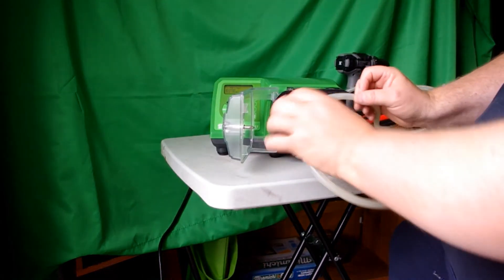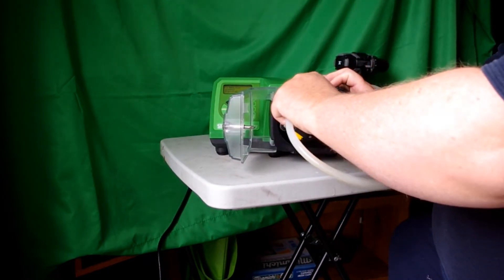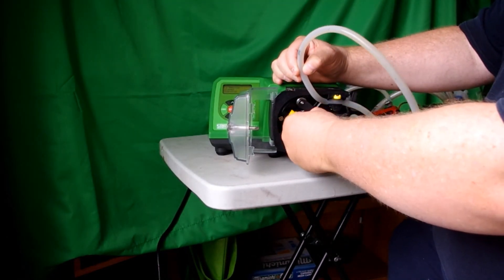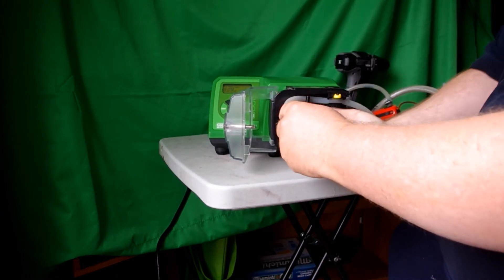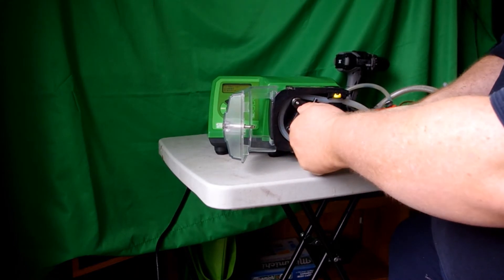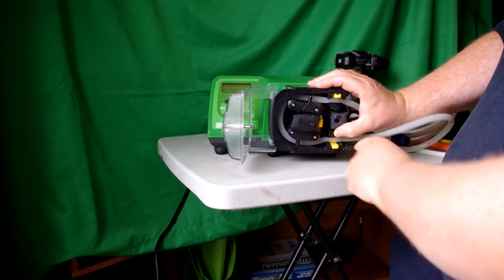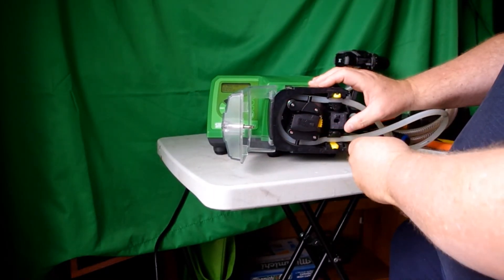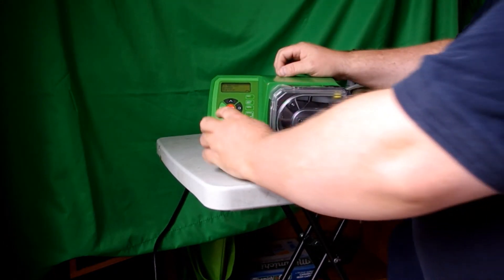When installing the tubing, open up the pinch clip. Now using the two roller guides right here, follow the roller guides as you insert the tubing into the pump, lift up the pinch clip, make sure the tubing is resting on the track. Once it's done so, release the pinch clip, close the pump head, and hit start.